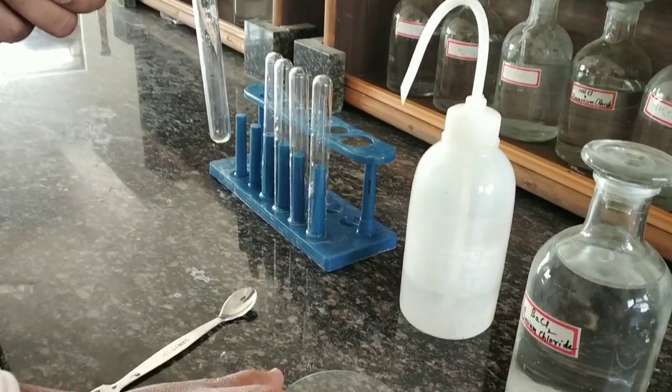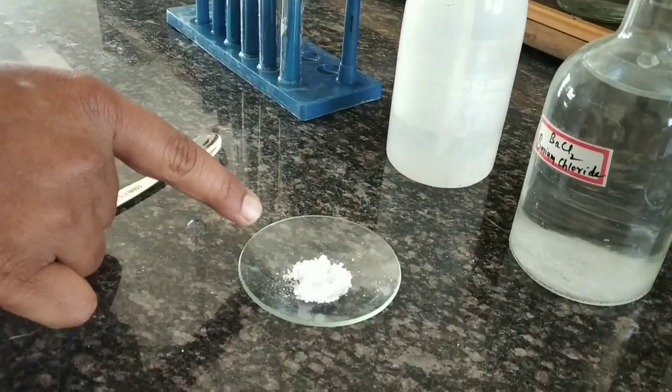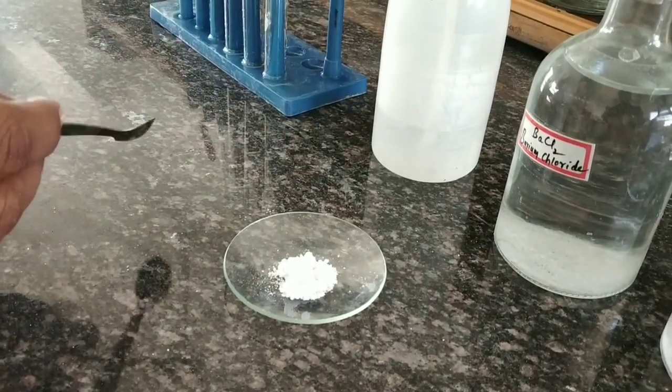Hello students, we are going to test the sulfate ion in the given salt. This is a crystalline salt.